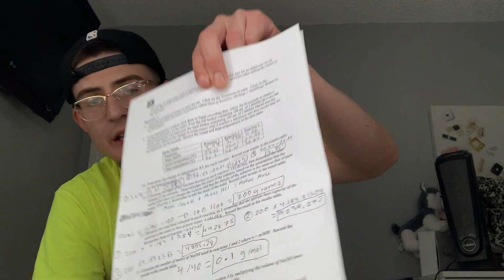For each reaction, we had different steps and procedures to go by. After following the steps and procedures, we then had to fill out our data table right there. Our data table consists of each reaction and their mass of NaOH, initial temperature, and the final temperature. For the first reaction, the mass was 3.998. The initial temperature was 25.01 degrees Celsius, the final temperature being 30.9 degrees Celsius.